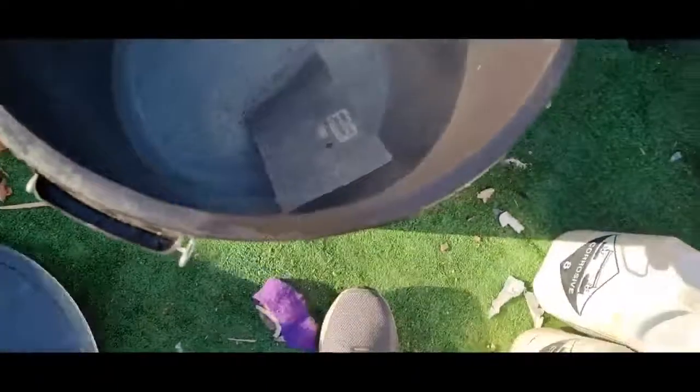Going a bit slow, but I'm going to just leave it overnight and see what it's like in the morning. I'm just going to show you the reason why you should be careful with hydrochloric acid and aluminium. I'm going to hold my breath when I go near it. As you can see it causes quite a big reaction and it heats up like mad, so you've got to be careful what you store it in and what you do.